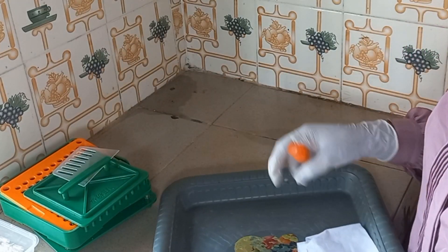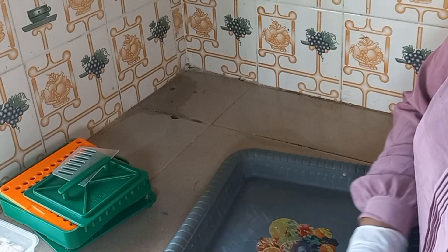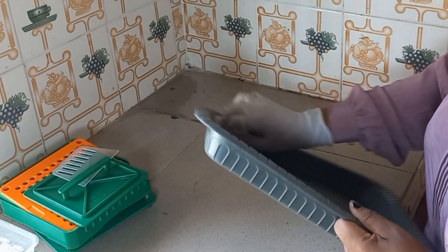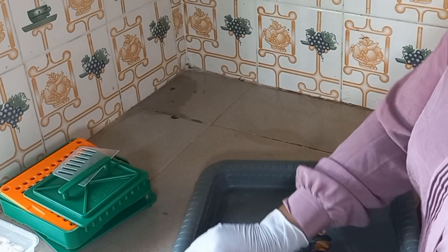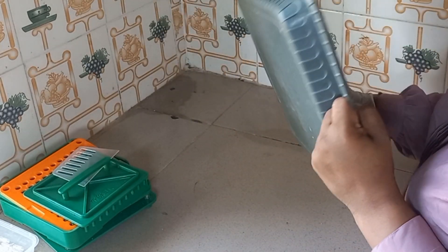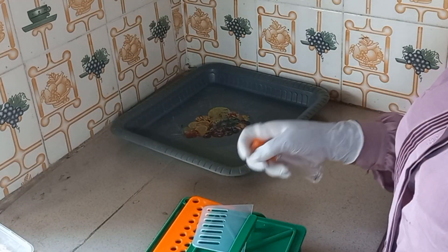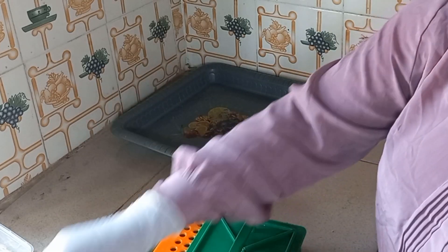The first step is to sterilize everything we're using. I'm using this tray — it's not a mostly used tray but I love using trays. Make sure to sterilize everything you'll be using, including the spray part and everything.